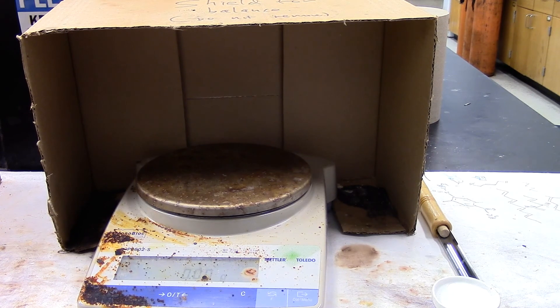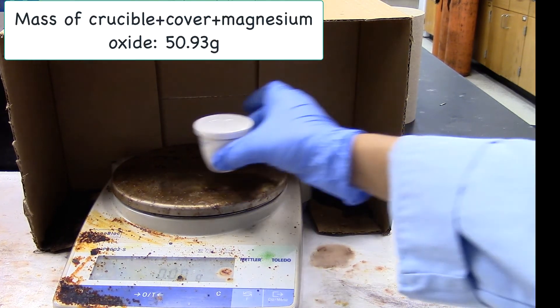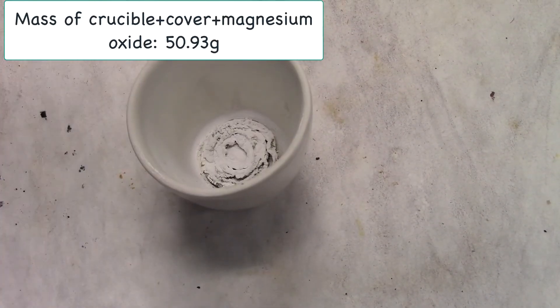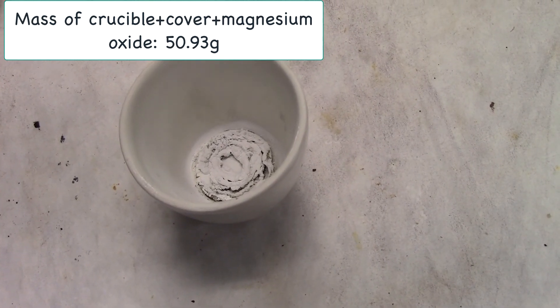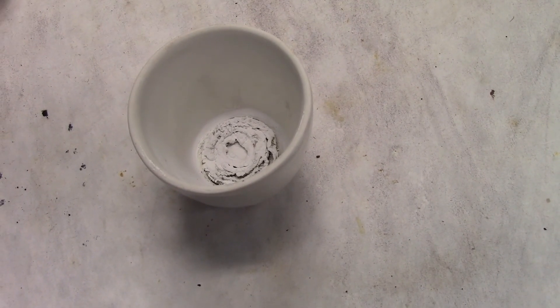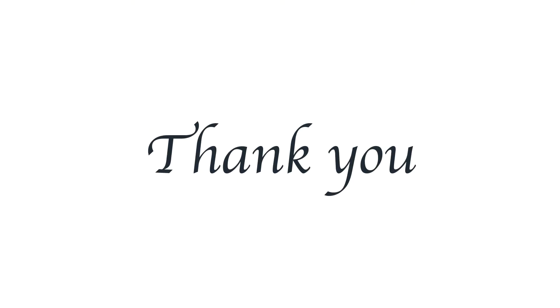Tare the balance. After the reaction, the product looks like this. We'll dispose this in our labeled waste container. I'm going to put it here. I'm going to put the lid right here.